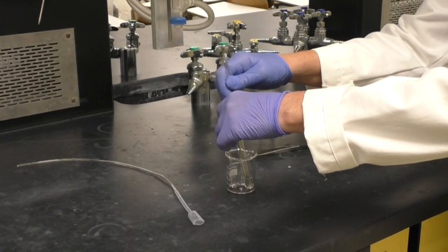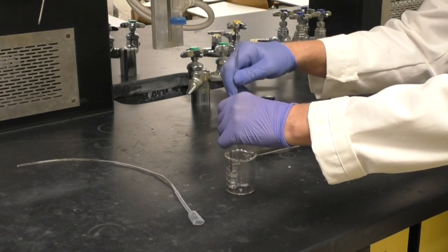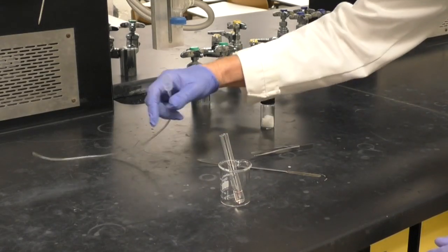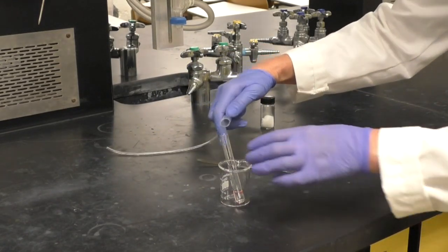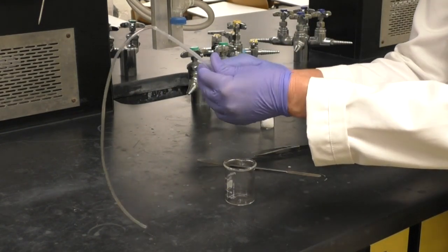Using a micro spatula, scratch the aluminum foil. When activated, a slight red color will appear and bubbles will begin to form. The solution will eventually become a red-orange color.